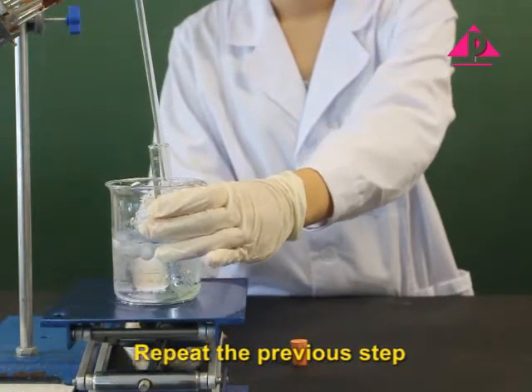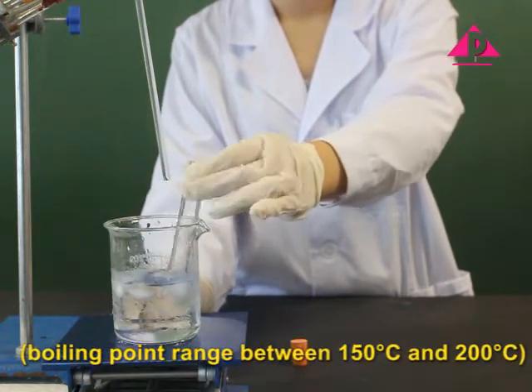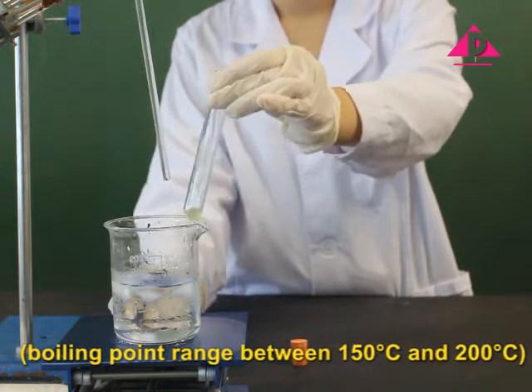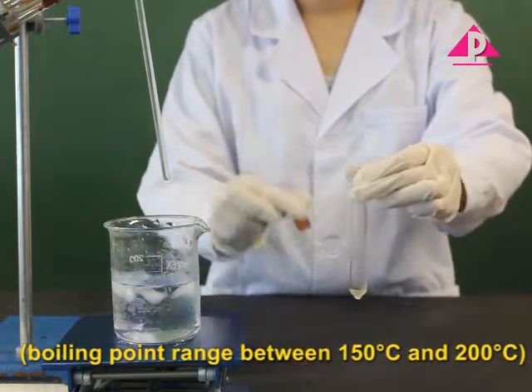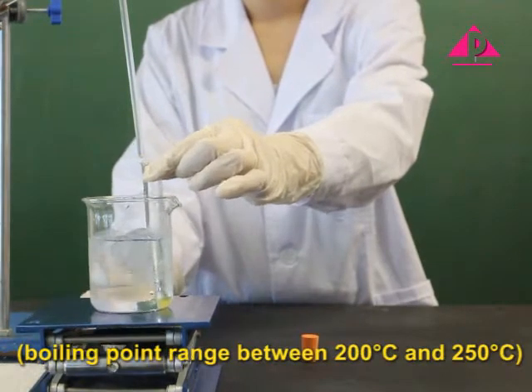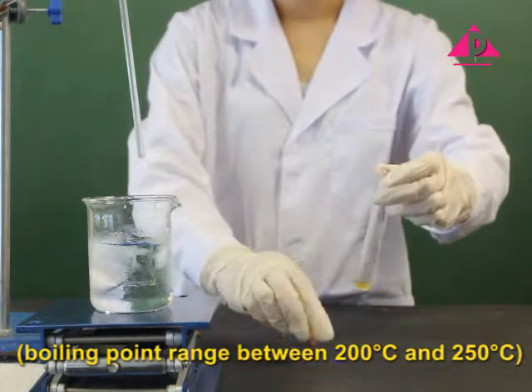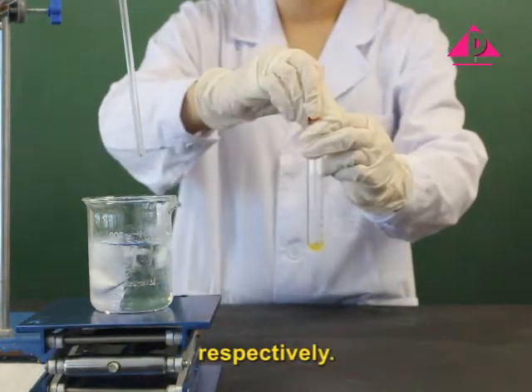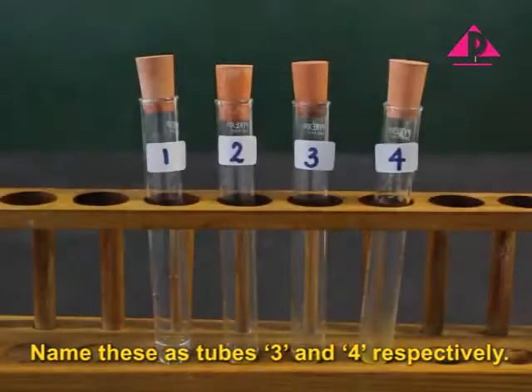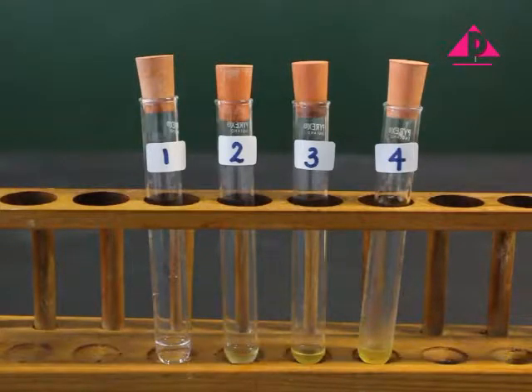Repeat the previous step to collect fraction 3, boiling point range between 150 degrees Celsius and 200 degrees Celsius, and fraction 4, boiling point range between 200 degrees Celsius and 250 degrees Celsius, respectively. Name these as tubes 3 and 4, respectively.